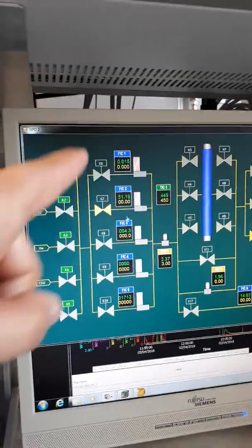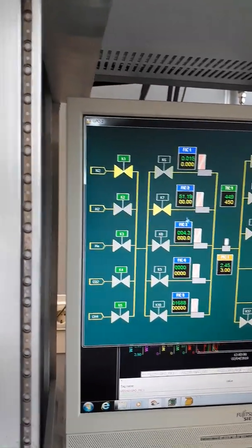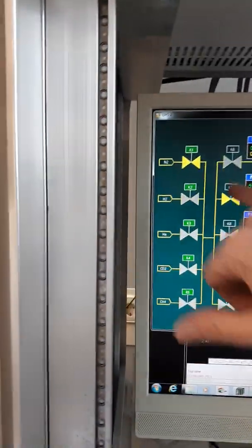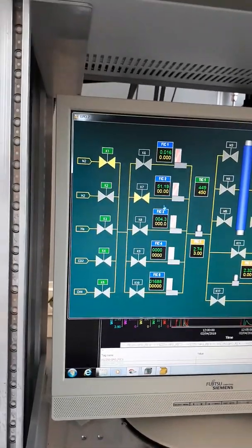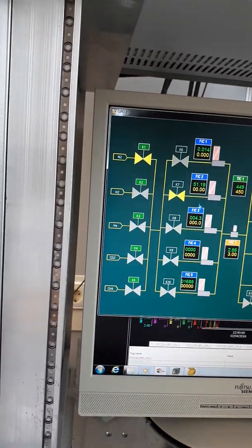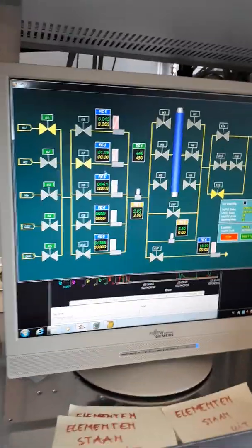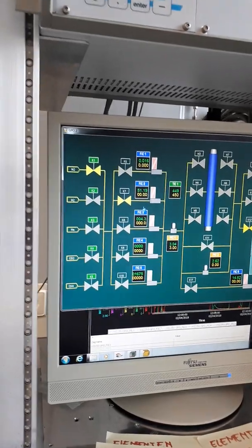Then why did you suddenly open the low flow? Now, or just before, when it is going to be reached at 3? Because with this one, it's filling up so fast that you have an overshoot in pressure, and the overshoot has to be decreased. But if the system is almost dense, it takes so much time. That's why I don't want to have an overshoot, or just a slight one, so that you win time in the decreasing part. Looks like different layers got peeled off.